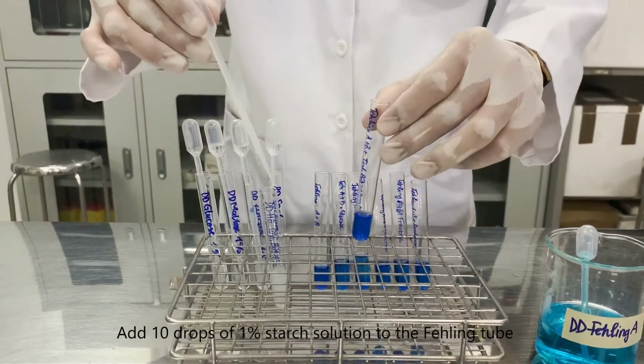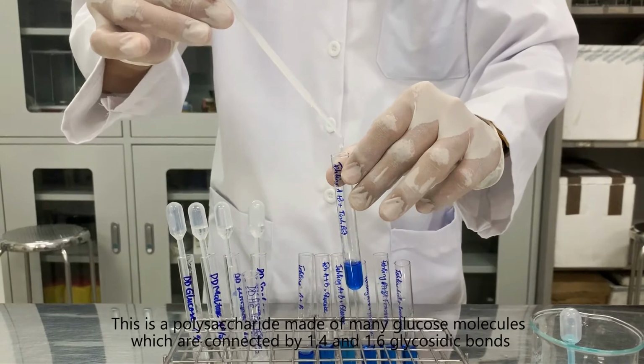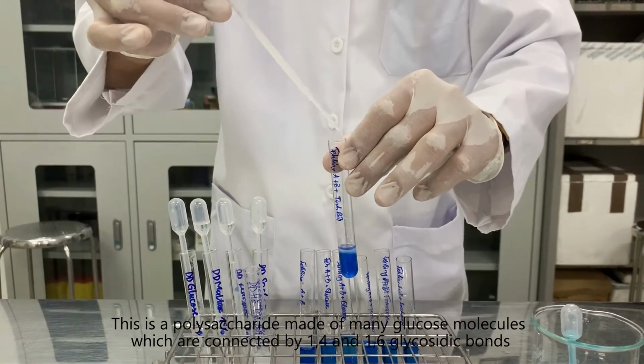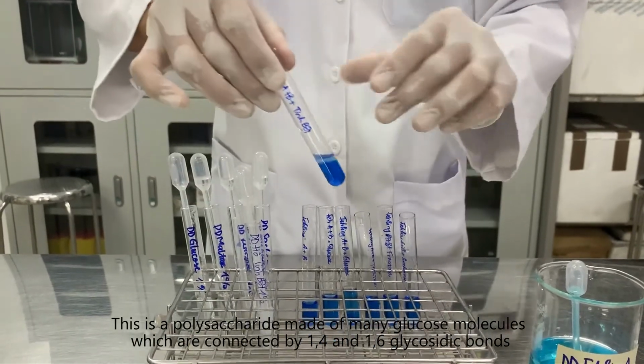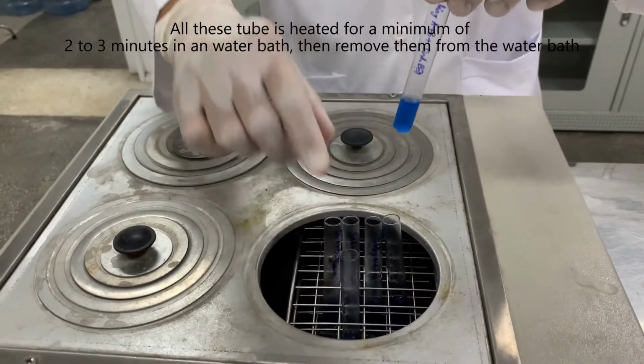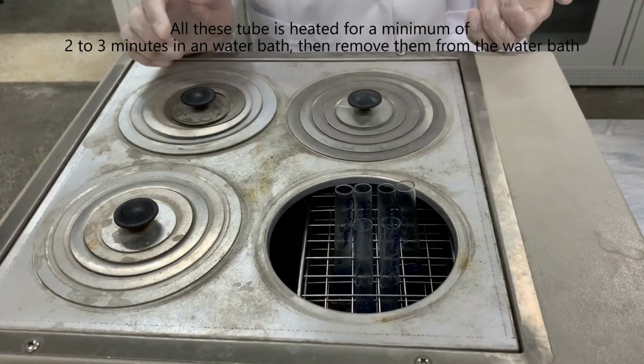Add 10 drops of 1% starch solution to the Fehling tube. This is a polysaccharide made of many glucose molecules which are connected by α-1,4 and α-1,6-glycosidic bonds. Then the tubes are heated for a minimum of 2 to 3 minutes in a water bath, then removed from the water bath.